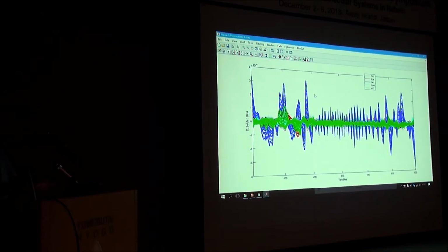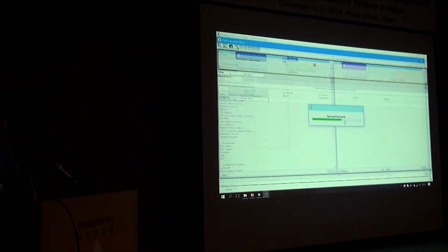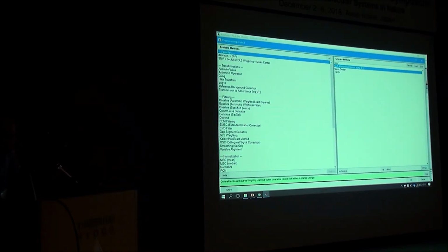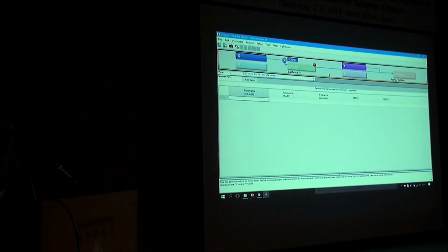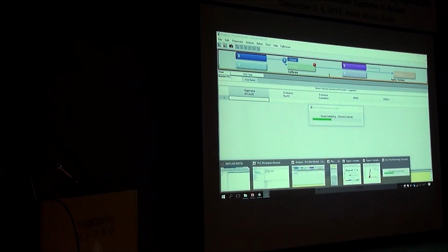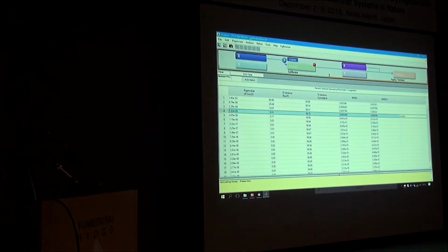This is sodium and potassium. Now, do you want to decrease it? You see what happens if you decrease it. 0.1. So it should be less deweighting. It means you should get more of the spectra.